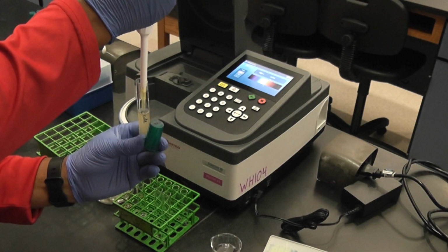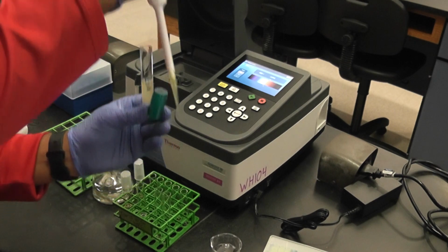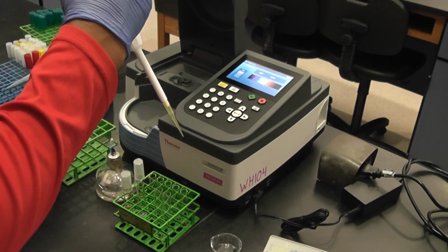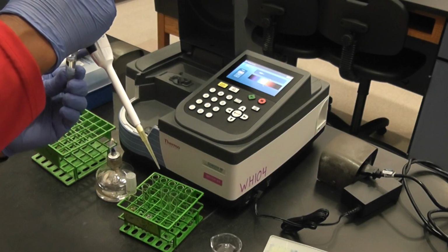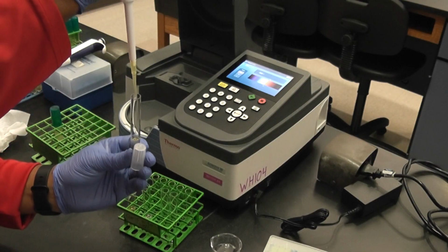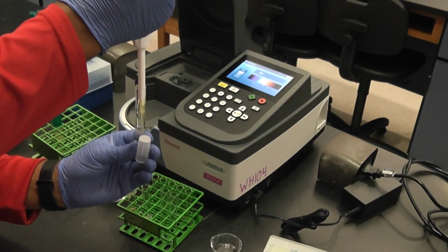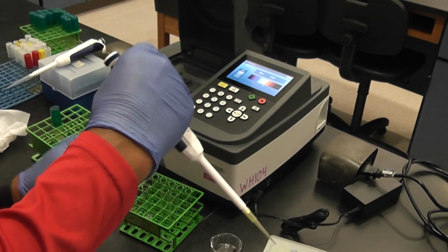Suck it up and down a couple times. Come out. All right, I put 100 into that one.